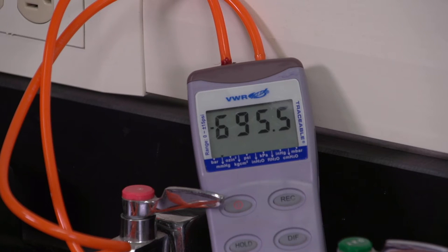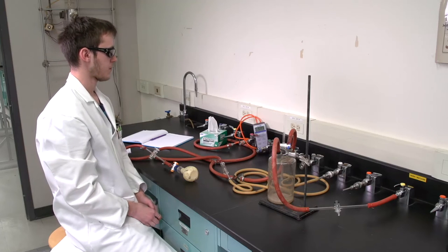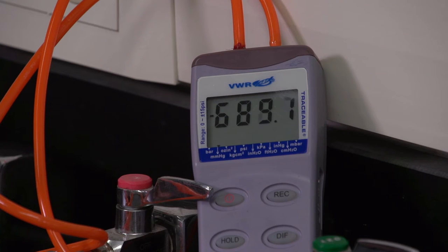Check the manometer. If the reading is steady, there are no leaks. If the number is decreasing, there is a leak.